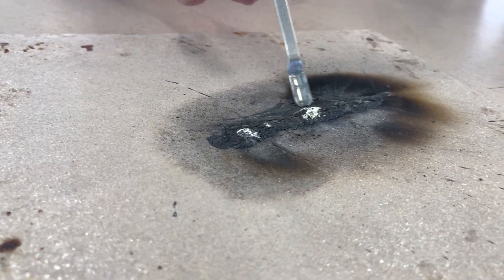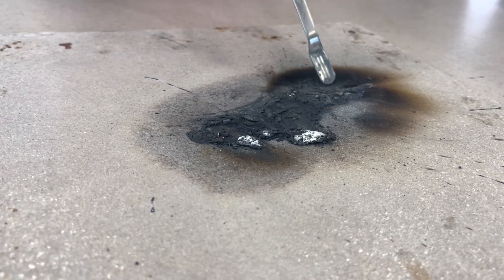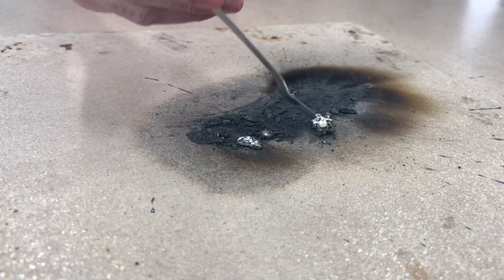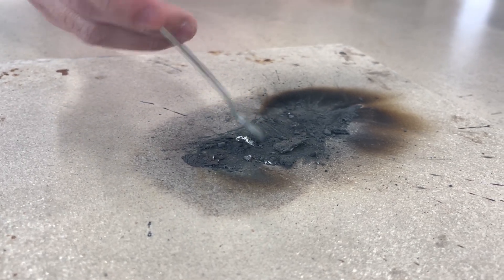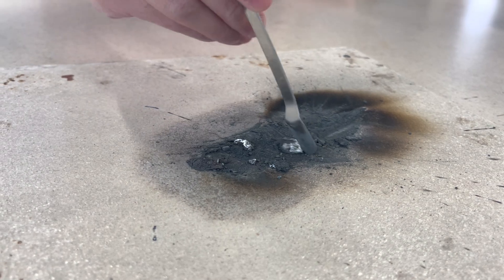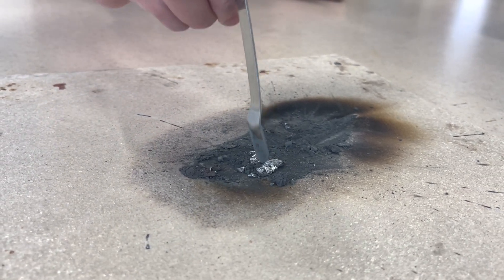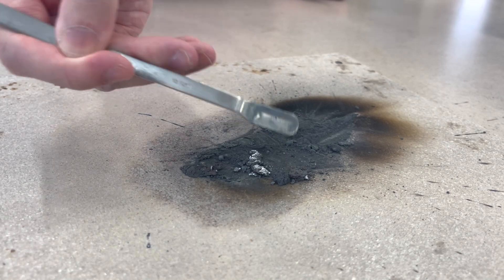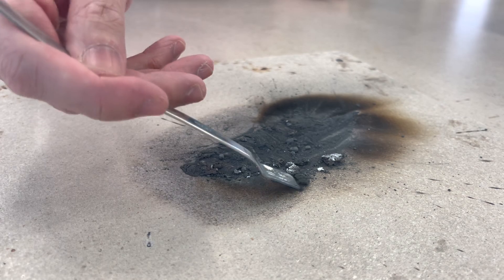You can see there is some yellow solid over here. Let's wait and observe — there is also a color change afterwards. This yellow solid, when it cools down, the color will change as well.